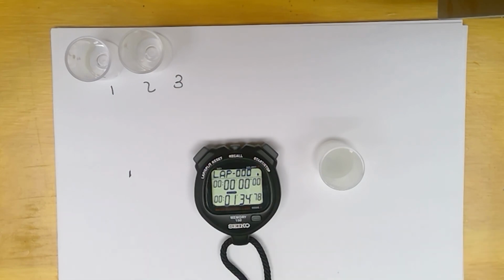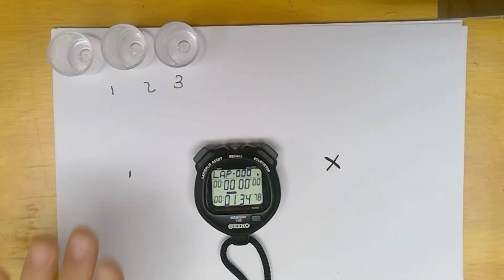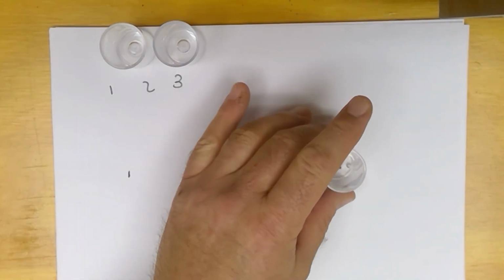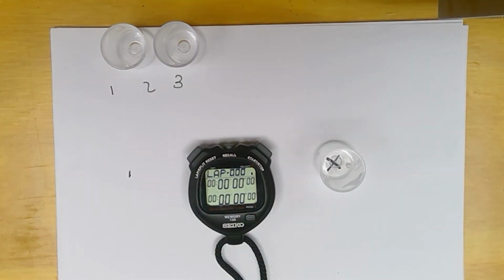Okay, so now we're going to redo it. I'm going to pause you and I'm going to clean up and switch over and we'll do it again. Okay, so I've refilled them already. We're ready to go to do our second trial. So this is well number 1 again. Oops, I didn't reset. There we go.